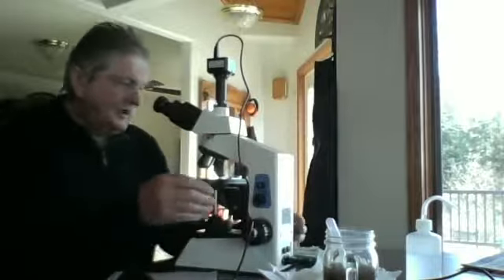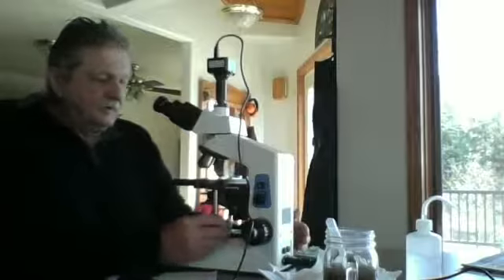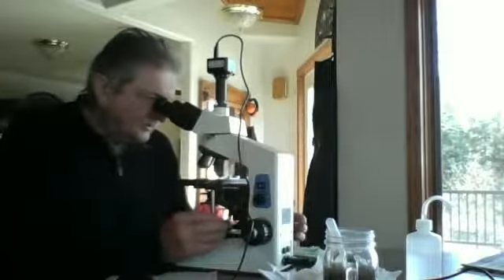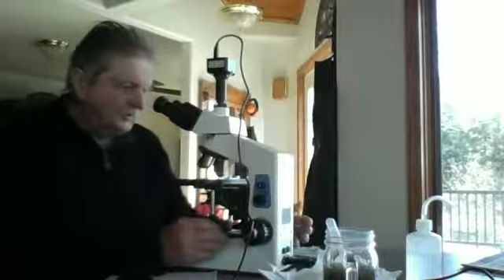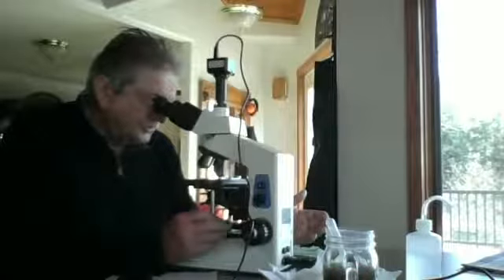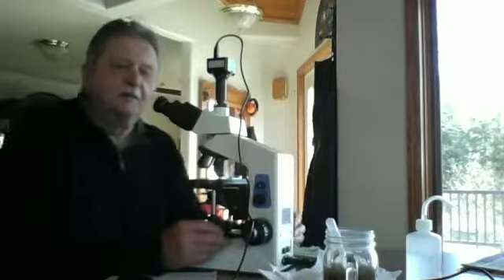Oh yeah. Now I'll begin by adjusting. I usually go to the edge of the scope and then go to my upper right until I find that edge. And then I'll go 2 turns up and across, and I'll begin my sampling at that point.